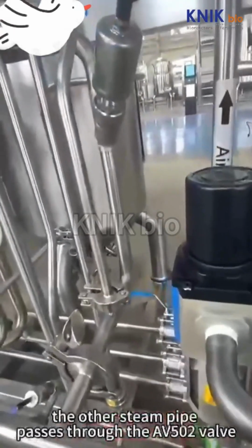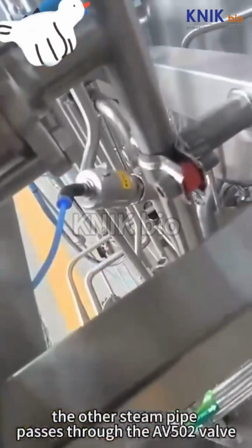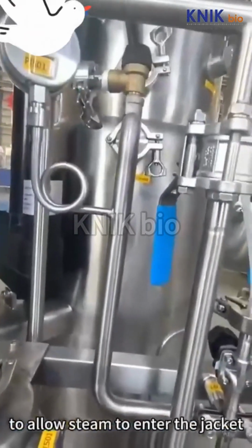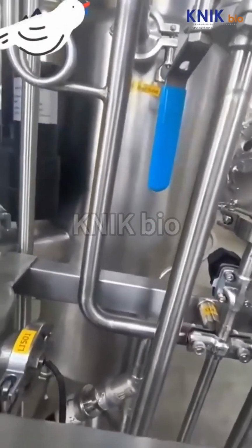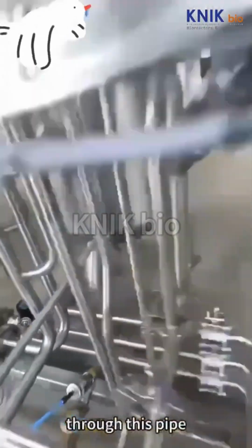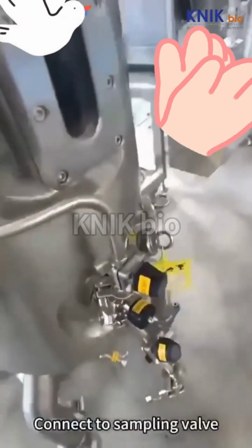The other steam pipe passes through the AV502 valve to allow steam to enter the jacket. Through this pipe, connect to the sampling valve.